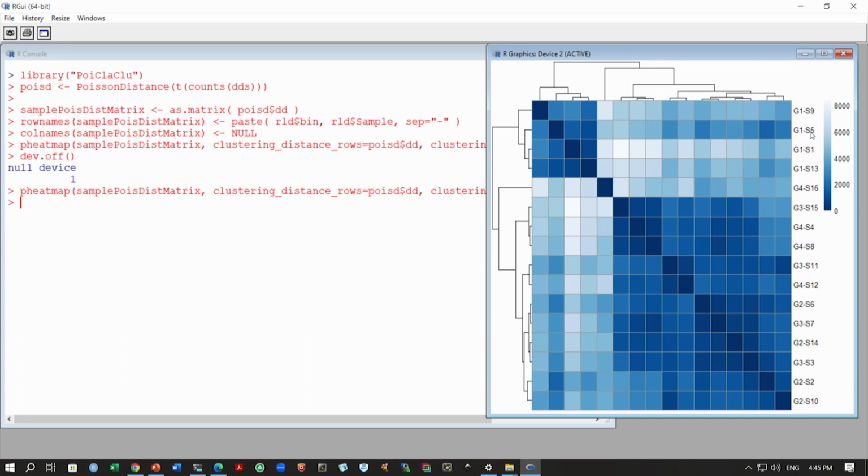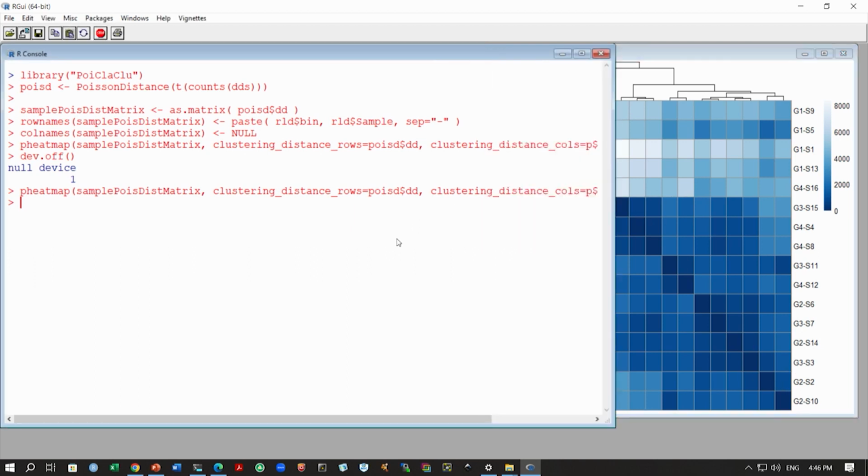You can see G1 S5, G1 S9, these are the sample names, and again you notice the same thing. These G1 samples are very close to each other. Darker color means smaller distances, and white color means larger distances, and here the distance is in terms of counts. As you can see, the rest of the groups cluster together very nicely, like G2, G3, G4, and as before there is an outlier, G4 S16 in this sample looks like an outlier. It does not cluster with this group here or with the G1 group here. So, this gives the same results.